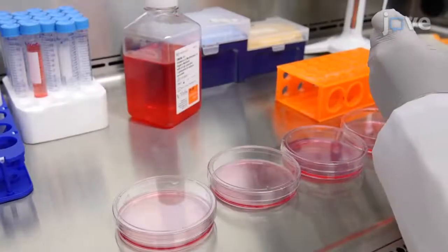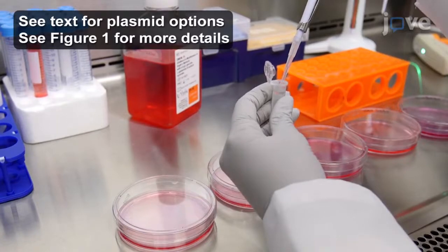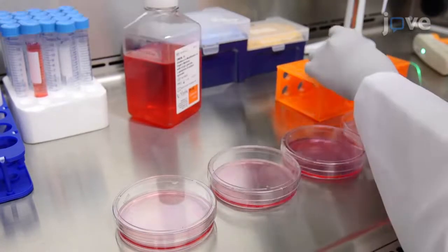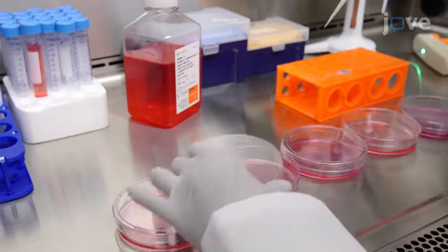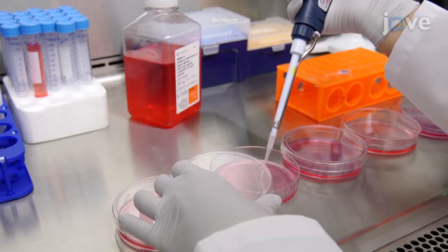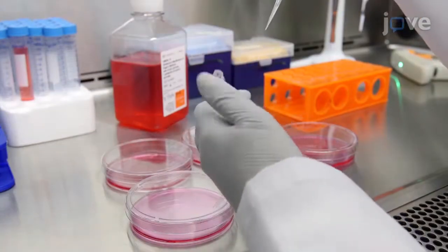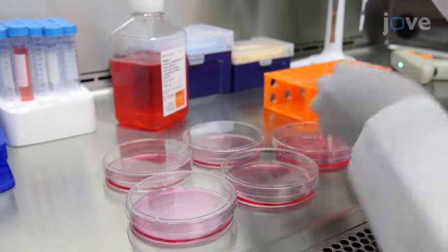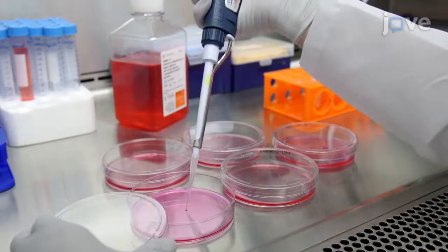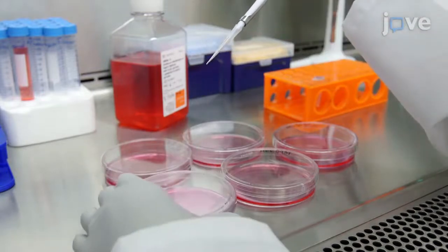Once the cells are 80-90% confluent, use a lipid-based transfection agent to transfect 5 of the plates. Perform the transfection following the manufacturer's instructions for adherent cells in 10-centimeter plates. Then, transfect an identical second set of 5 plates, along with one additional plate serving as a non-transfected control for the measurement of expressed protein amount before the immunoprecipitation.